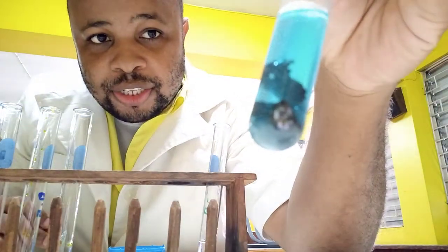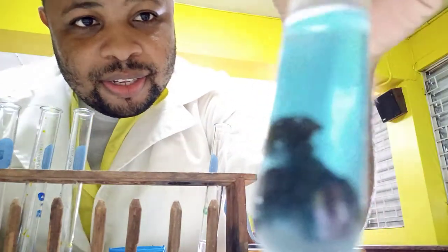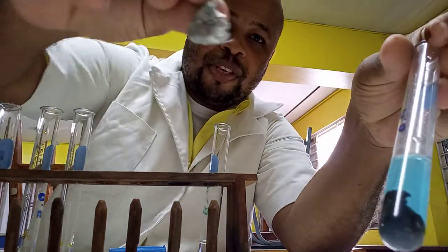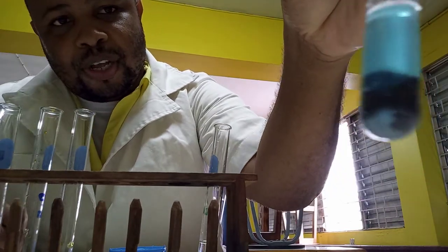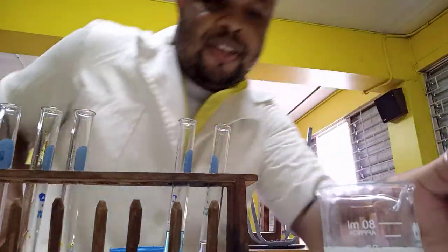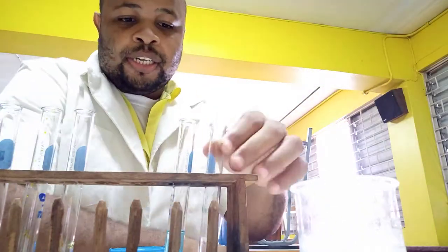As you can see, the appearance of the zinc is changing. This was the original appearance of the zinc metal — it had no color. We should also take note of the color of the copper sulfate so we can compare them. I will come back to this reaction in a few minutes.